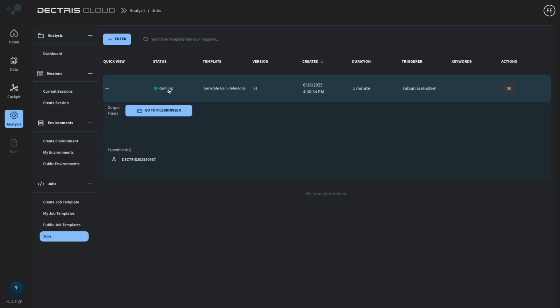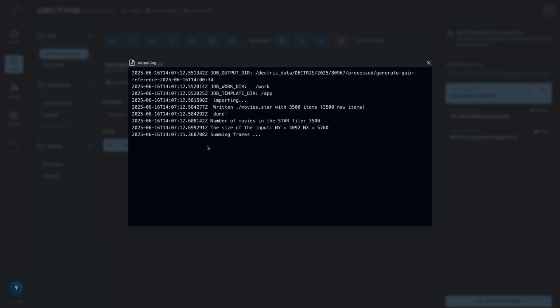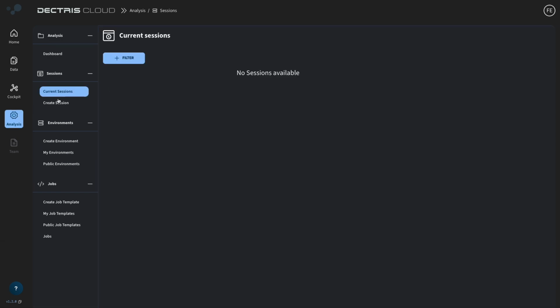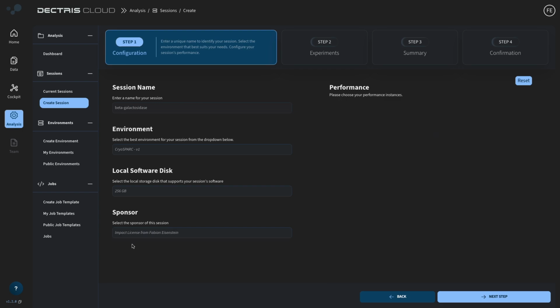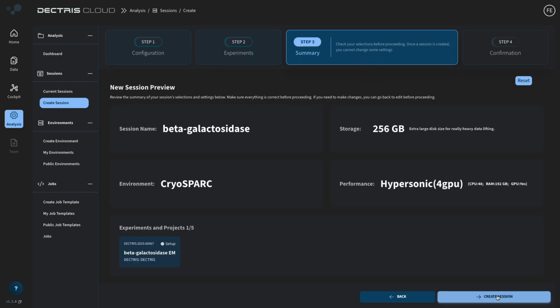And it's running. While it's running, we can quickly check out the output log to see if it's actually doing what we want, and it looks promising. It detected 3,500 movies and it's starting to sum up the frames. In the meantime, we can already go ahead and start a CryoSPARC session. That means we'll choose the CryoSPARC environment and choose a GPU performance node we want to use. Mount the dataset and start the session.